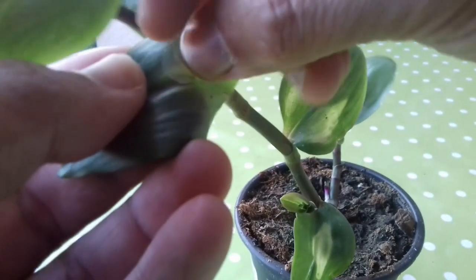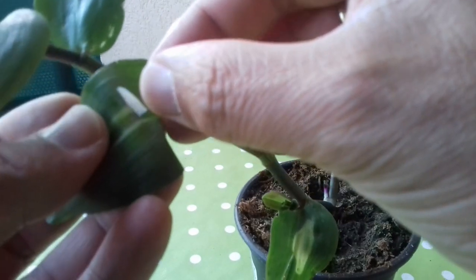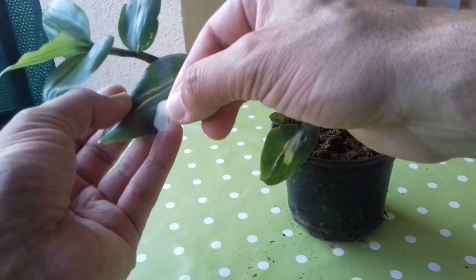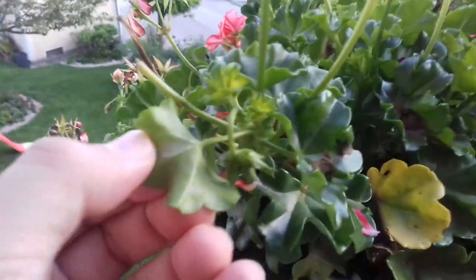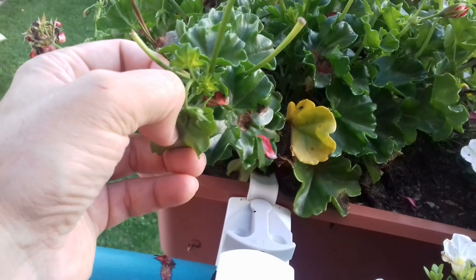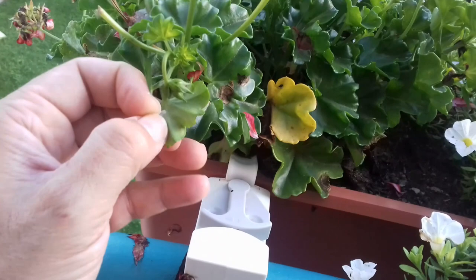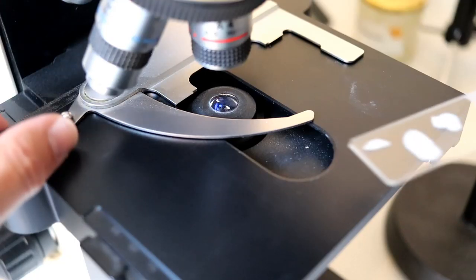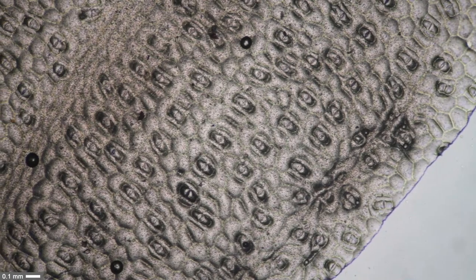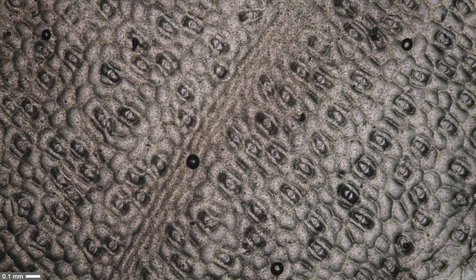This one is the other plant with a smooth lower surface, and I hope it's easier to peel off here without damaging the leaf. Look at this — very easy to remove! That one too. Getting the sunflower one off was also not so easy. General advice: when you do this for the first time, choose leaves that are very smooth. I simply placed the samples on a slide — no cover glass, no mounting medium. Using the low power 4x objective, this is the monocot plant, the second one that was so easy to remove.